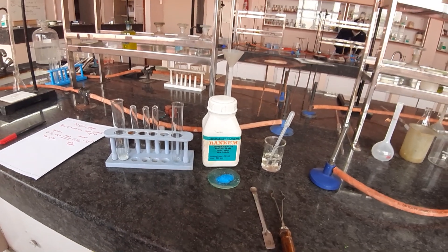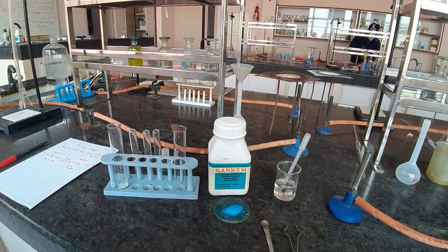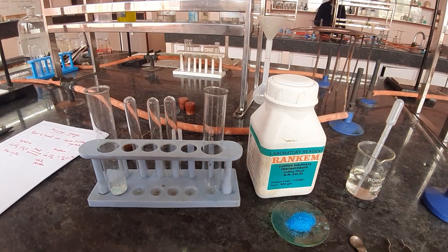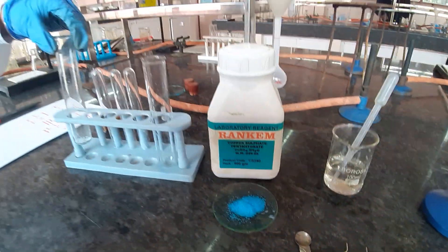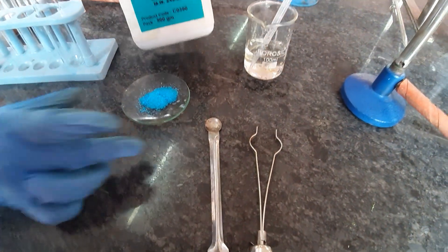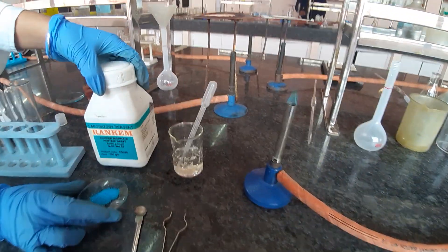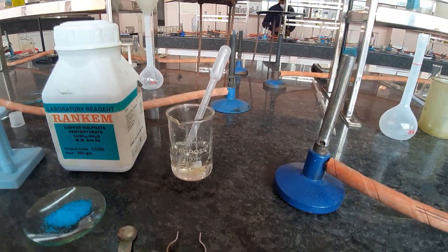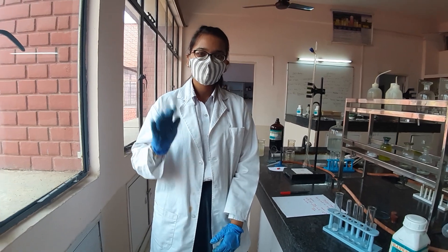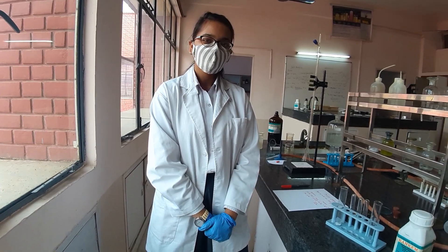Good morning class 9th. We are back to the chemistry lab with the next practical, which is a physical change to be observed in the chemical lab. You will require test tubes — this thick test tube is called the boiling tube. You have copper sulfate crystals which are blue in color. You will also require a burner and some water which can be added through a dropper. My student Suhani will be doing this practical demonstration for all the 9th class students. So let's begin.